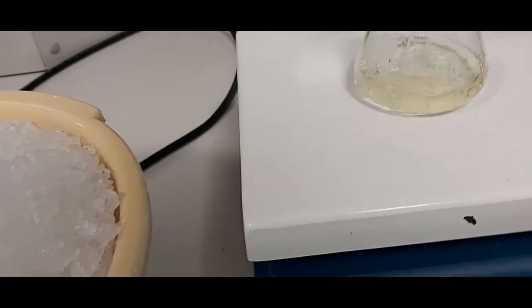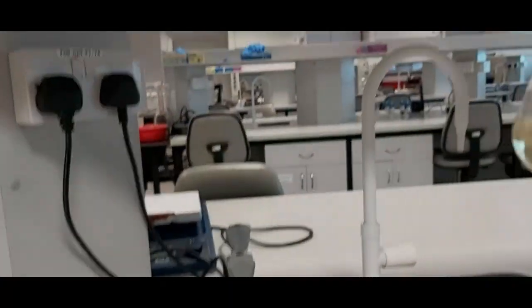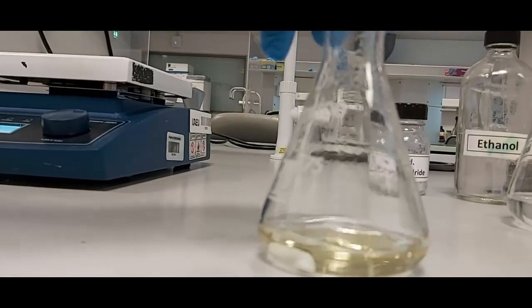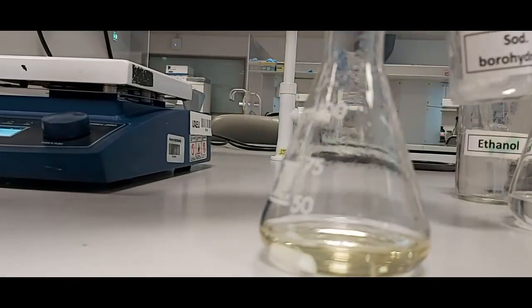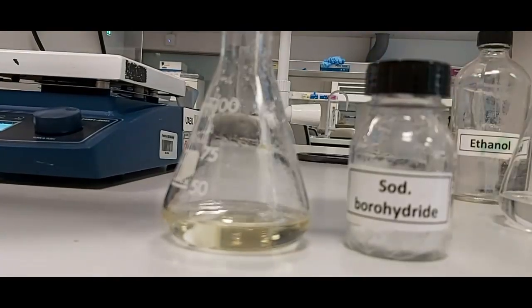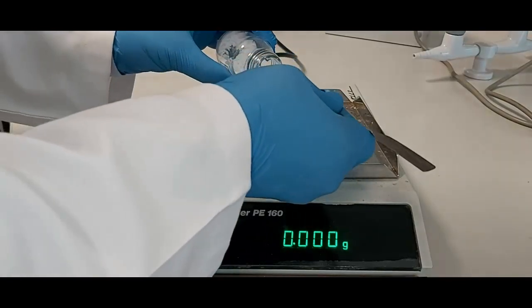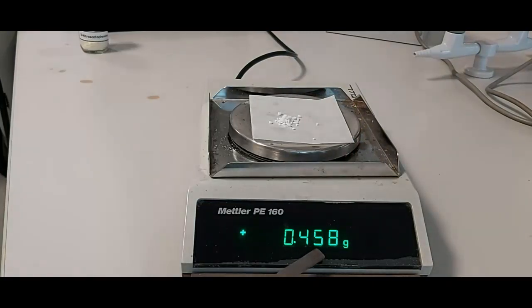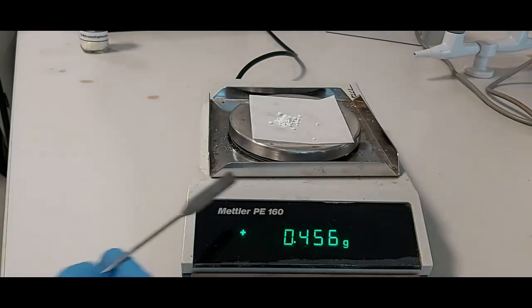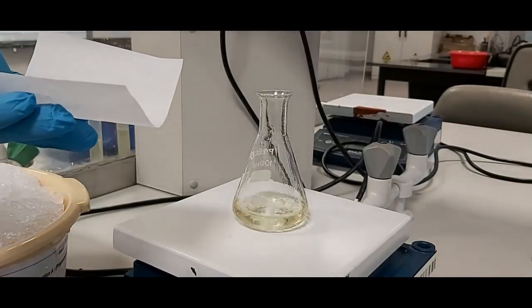I kept it on the hot plate until the product completely dissolved. The solution is completely dissolved — it is completely liquid. The next step is to add 0.45 grams of sodium borohydride.